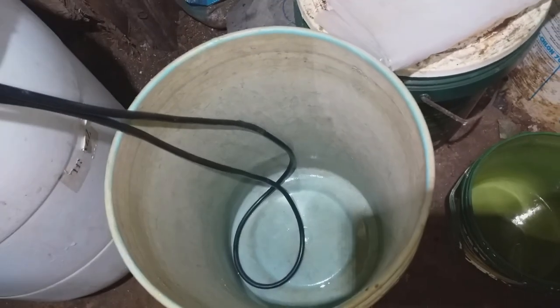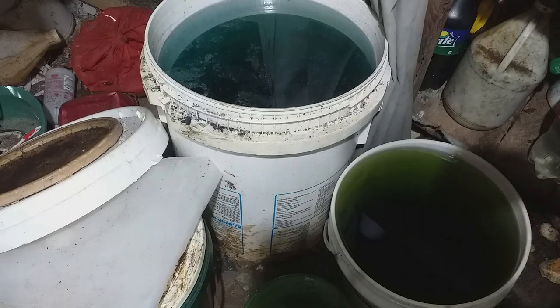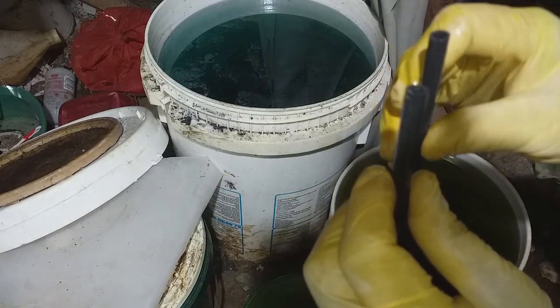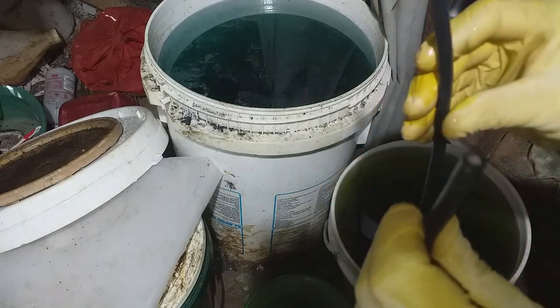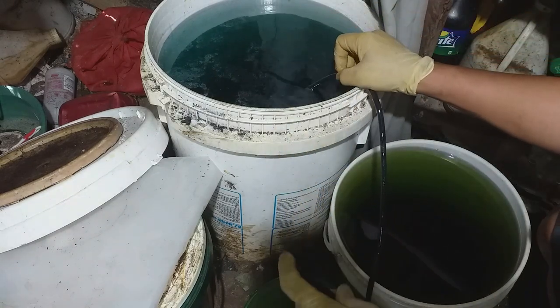I got copper precipitation here — much, much black powder. So let's decant this one by siphon using our rubber tube. This is our rubber hose, filled up with water so that you can siphon easily.